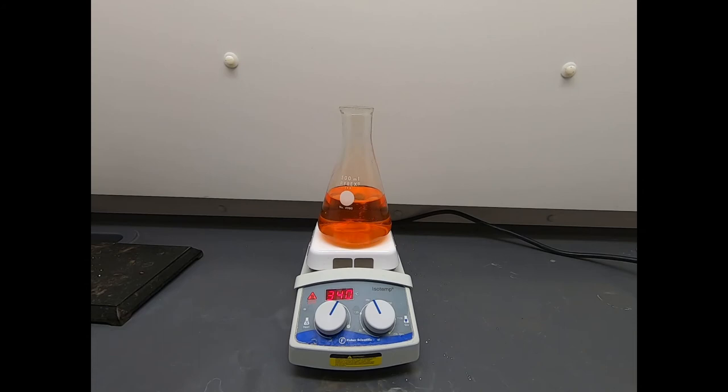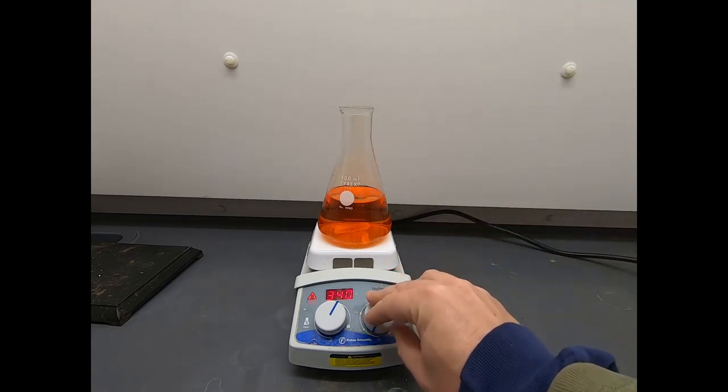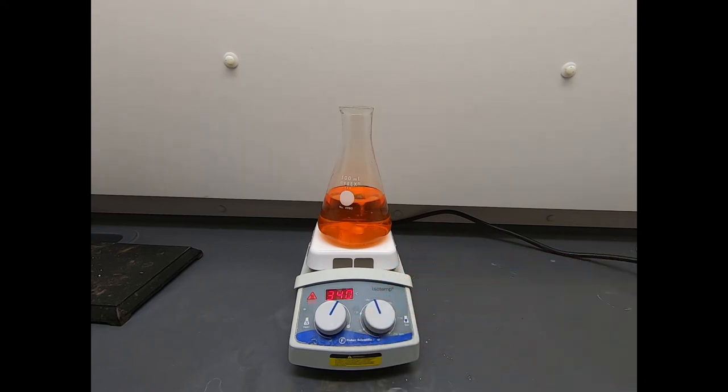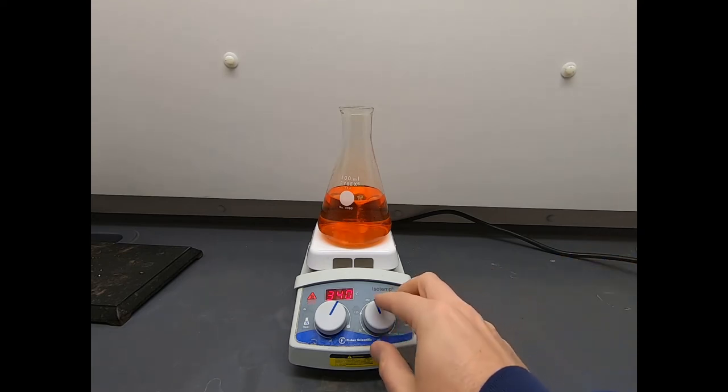Okay, now we have just about everything dissolved almost. There's still a little bit of solid in there, probably from the largest chunks that made it through the funnel. Note that if I turn off the stirrer, even though I'm heating the hot plate quite a bit, we're still not really boiling. So there's a little bit more room for the solution to get hotter, and as we continue to get close towards boiling, towards the boiling point of water, we'll probably eventually get everything to go into solution. Now you may say, but the hot plate says 340 degrees. How can this not be boiling? Well in a fume hood especially, you just have a huge amount of airflow past this flask. So even though the surface of the hot plate may be far in excess of 100 degrees, that doesn't mean the solution has actually achieved that temperature because you have all this air cooling. So the temperature of your heating surface does not always translate into the temperature of your flask because there's so much airflow in here, which of course is good. It's a safety feature.